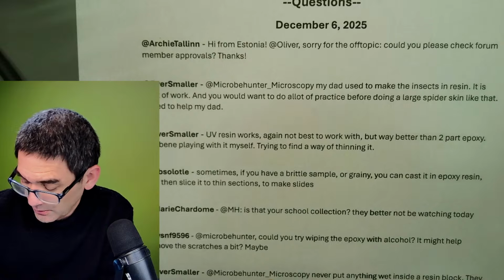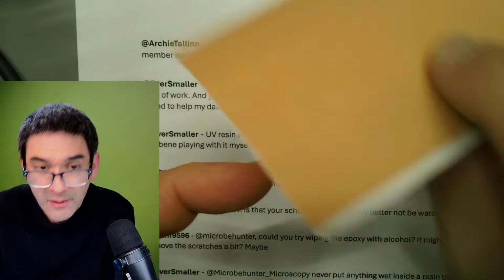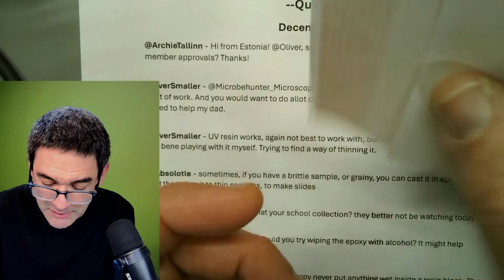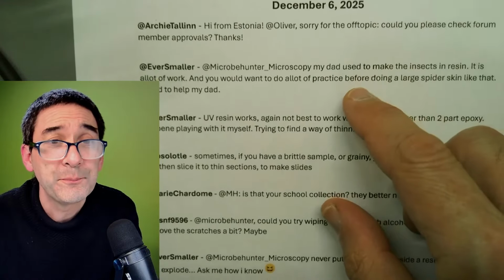Oh, okay. Look, I didn't realize this, that my son also put a plaster here. And so that's a little bit of a problem. So I still have to do this manually.